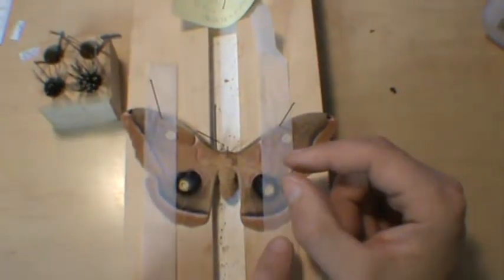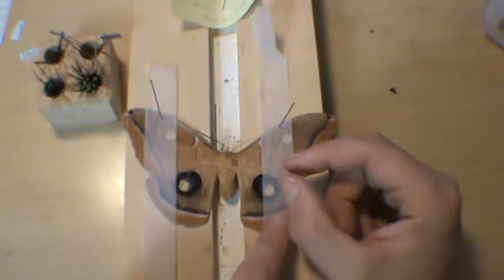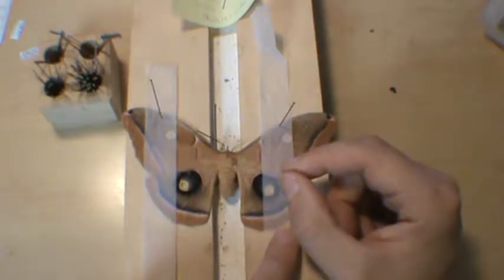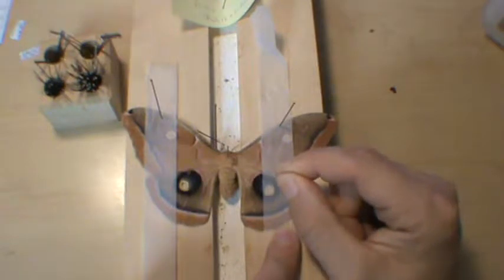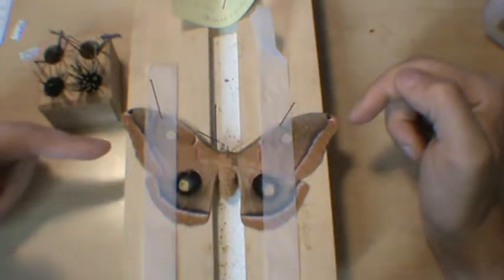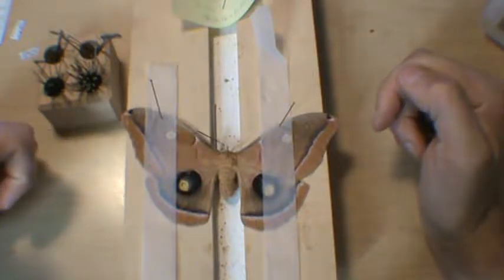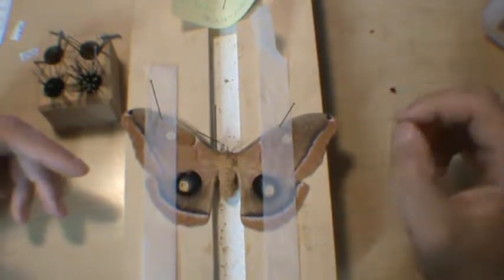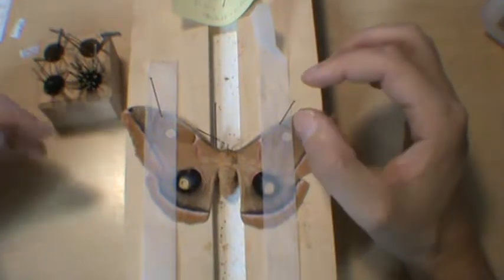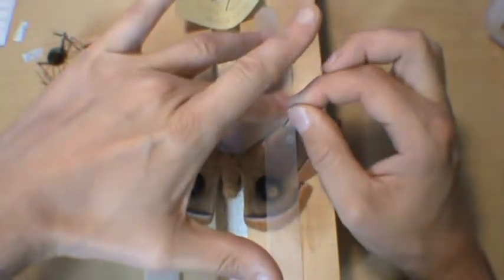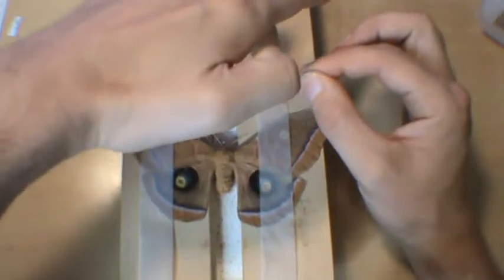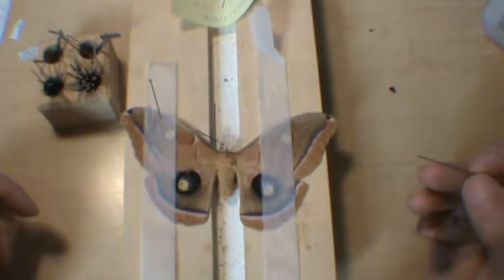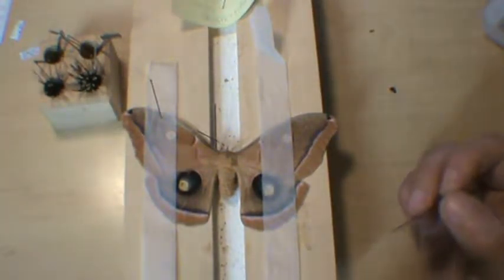I'll tell you more about using these strips when I pin my next butterfly or moth. This has got to be careful here because this pin is actually going through the wing and we don't want to damage the wing. What's really cool about butterflies and moths, besides their wings, is the colors on their wings. These colors are made out of a bunch of little itty bitty scales that lay on the membrane of the wings, kind of like shingles on a roof.